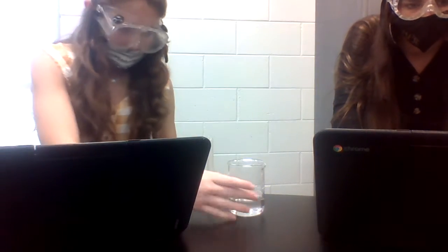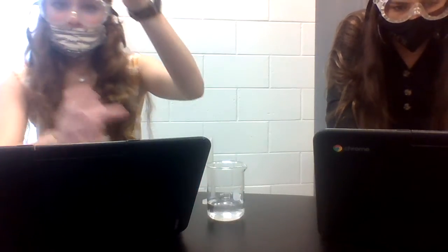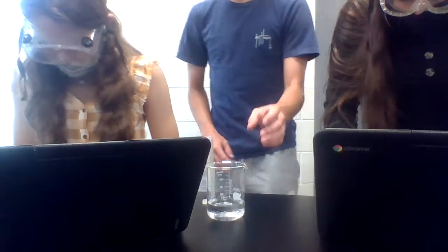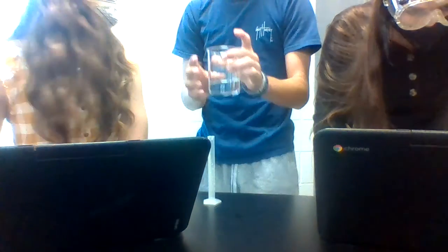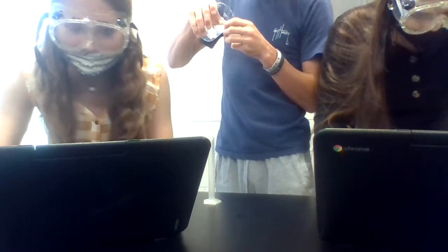Technically, right now, we're supposed to have 2 milliliters in there, but guess what? We don't got that. Yeah, that's almost two. Make sure you're reading the directions, guys, and following them. That looks like just one. So now I need 1 milliliter. Another milliliter. Whoa! That was a lot more than a milliliter. Come on, Dan. You're doing really good. That was supposed to be 3 milliliters, and it ended up being like 5.7.